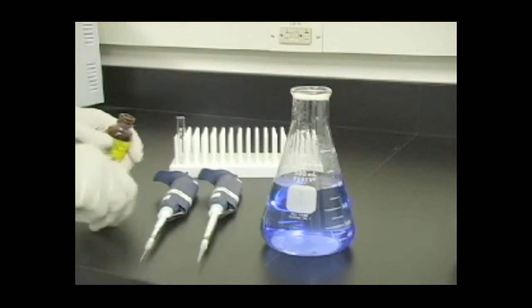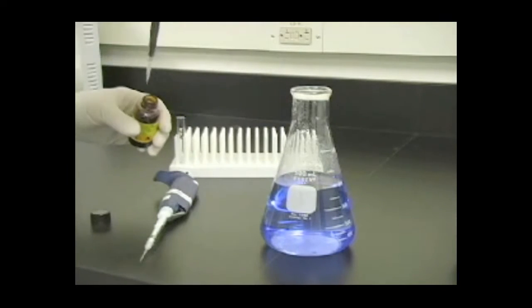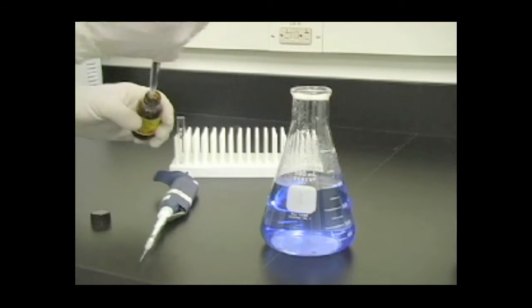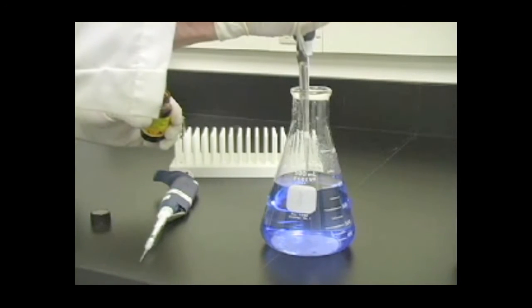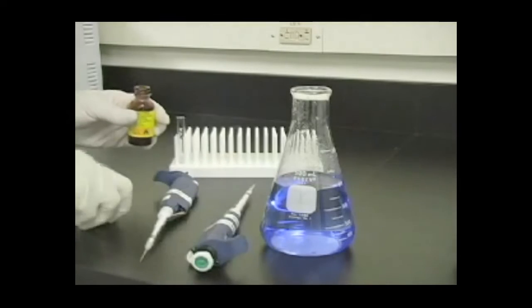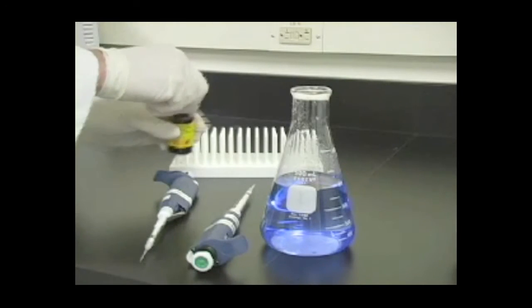In this video, we have artificially colored the solution blue so that you can easily see the flow of the solution. Be aware that your solution should not be blue, but clear. After degassing, add initiators to the gel monomer solution.